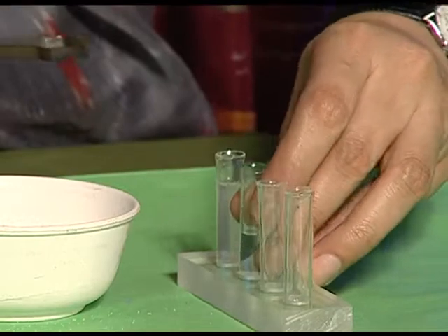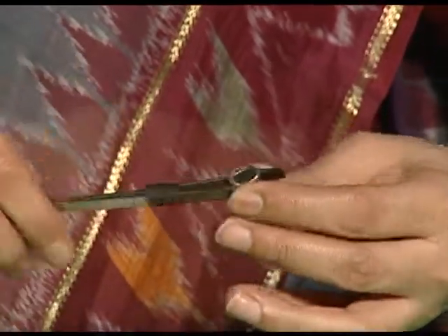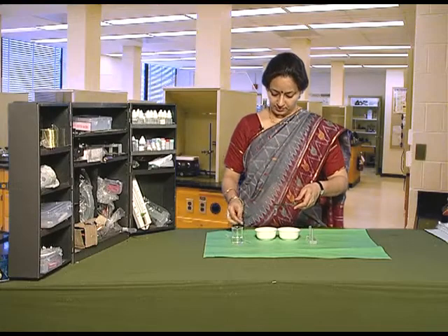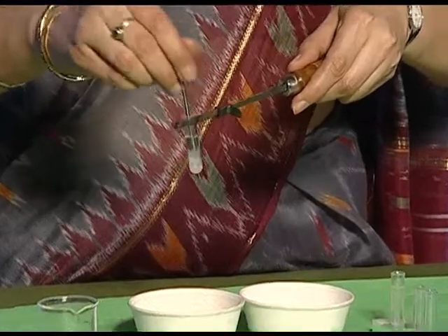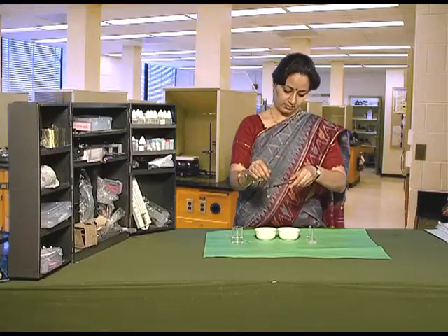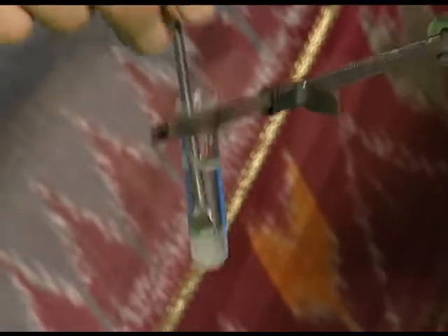Take the second test tube. The second solute we are taking is sugar. Add two spatulas of sugar and stir it continuously. What we observe here is that the amount of water available is not sufficient to dissolve this much amount of sugar in it.